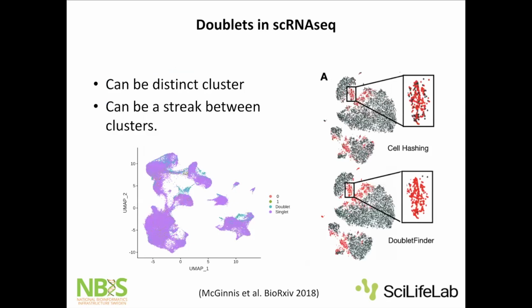When you look at the doublets in a UMAP, it's quite often these kinds of streaks where you can see clearly that they fall outside their cluster, a mix of this and that cell type, and they fall in between in the UMAP. But I think there was someone who asked at Hendrik's lecture about this with the doublets. I don't remember exactly what the question was.